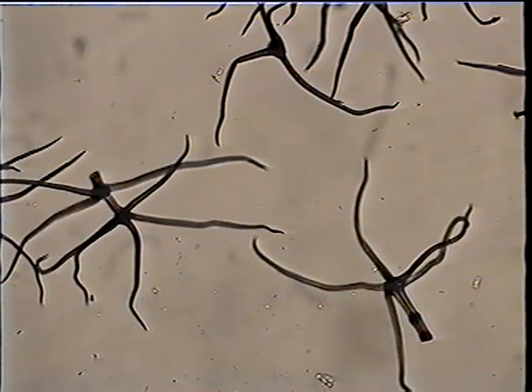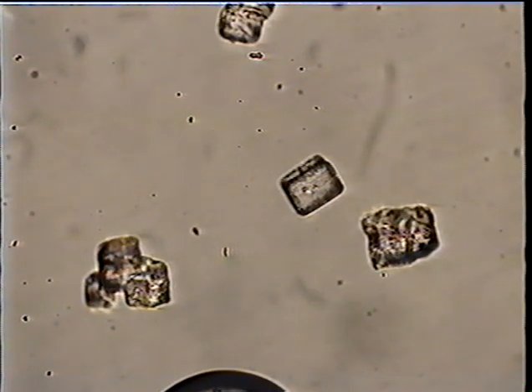The underside of the leaf is really felty from these hairs, thousands of them. These are salt crystals, sodium chloride, right out of the salt shaker on the dinner table. They are little cubes, distinctive in shape and optical properties. If we needed to measure them, we don't, to recognize them, especially when we shake them out of a salt shaker.